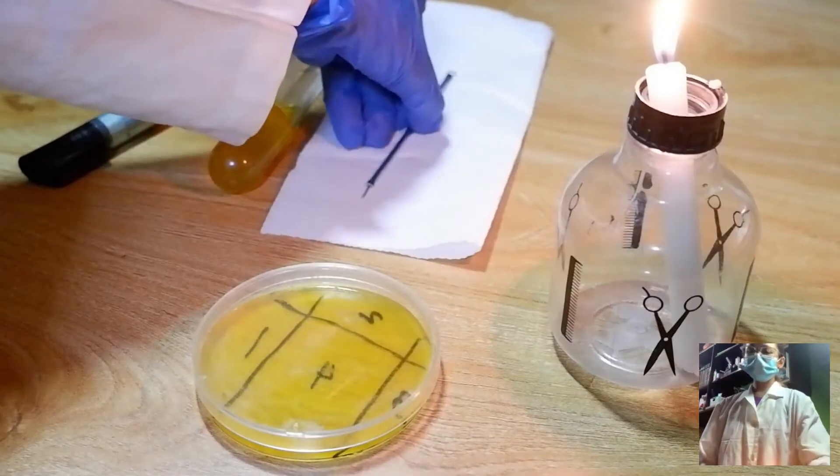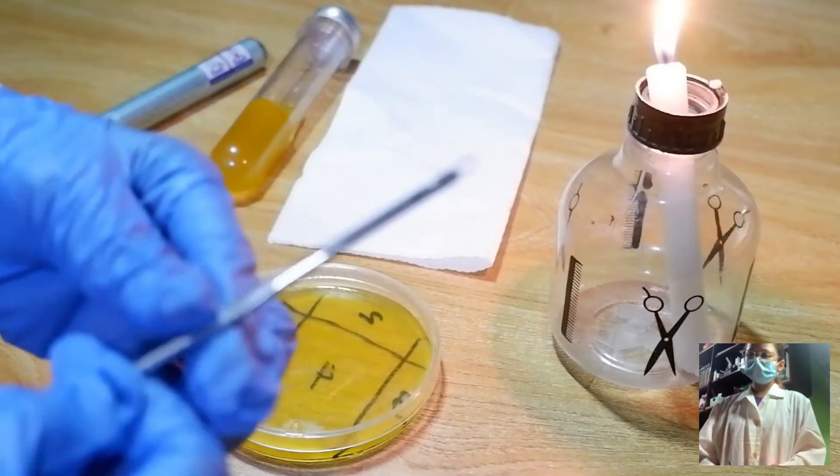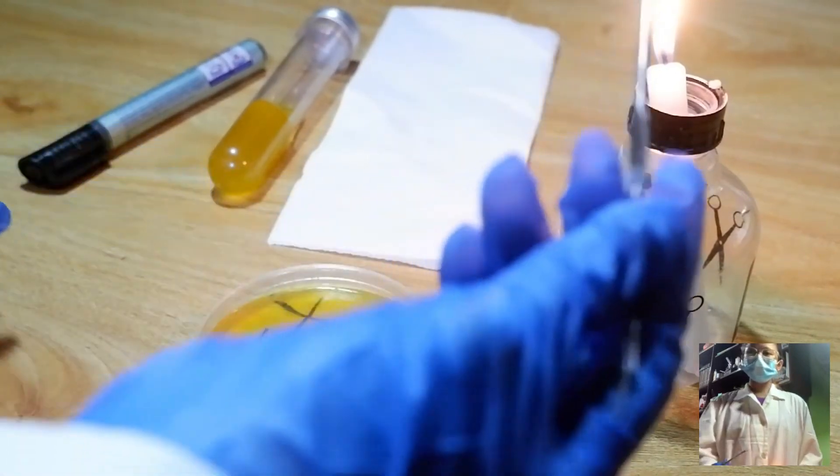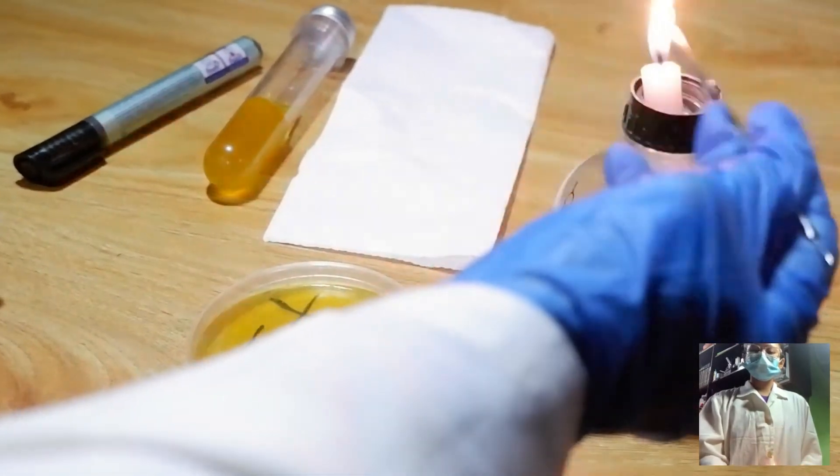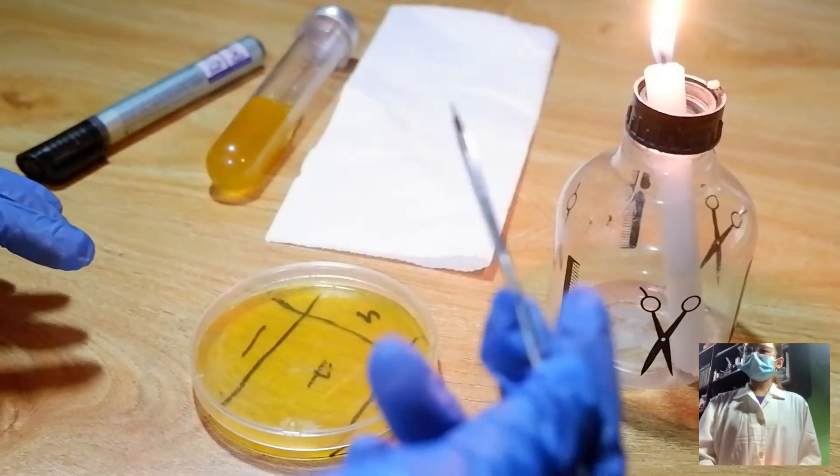Now, we will get our inoculating loop and we will heat it to sterilize. Now, let it cool for 5 to 10 seconds.